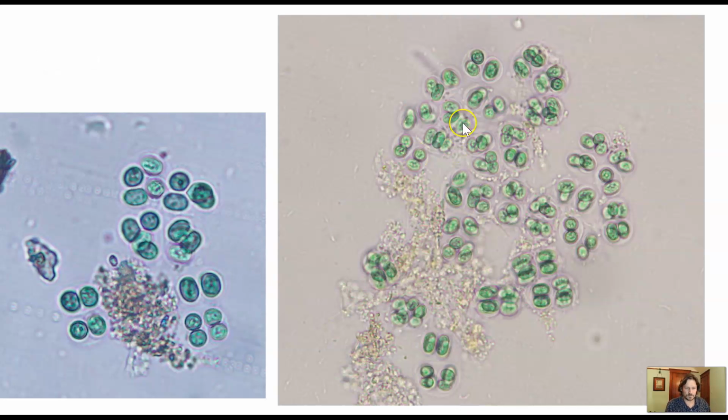And so here's another view. This is live material that I just used the microscope in the lab and took a picture of. You have to fiddle around when we're doing this in lab and learning about the microscope. This is a good opportunity to play with the iris diaphragm and the dimmer switch, because you need to turn down the iris diaphragm all the way to see these clear areas to the outside.